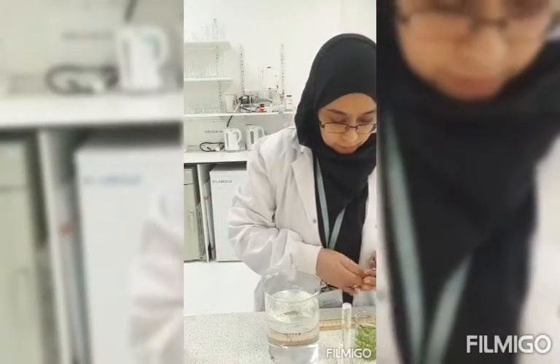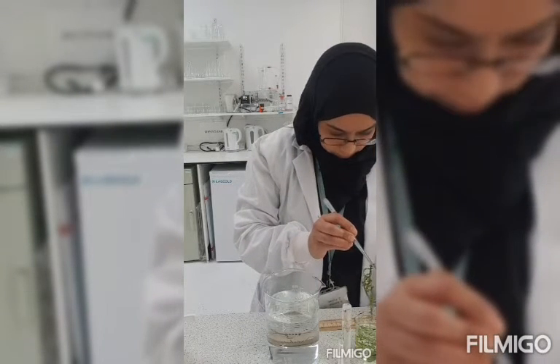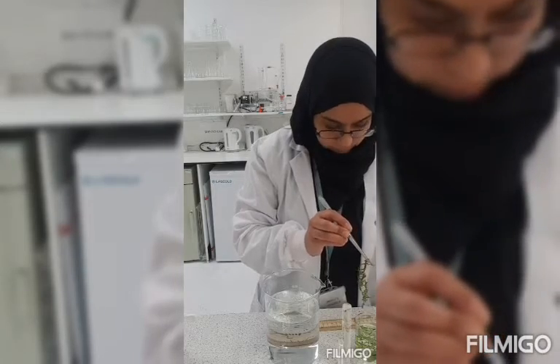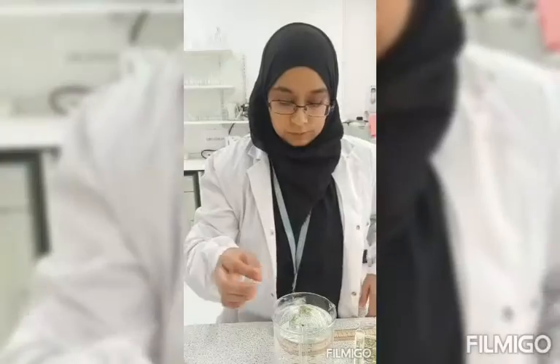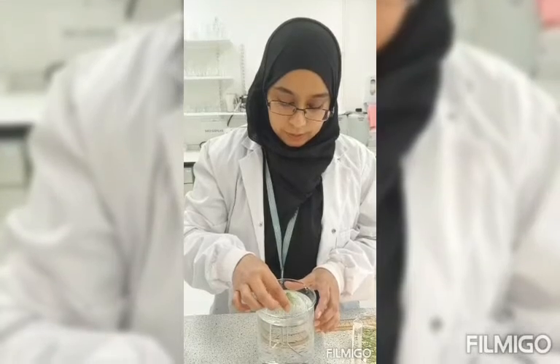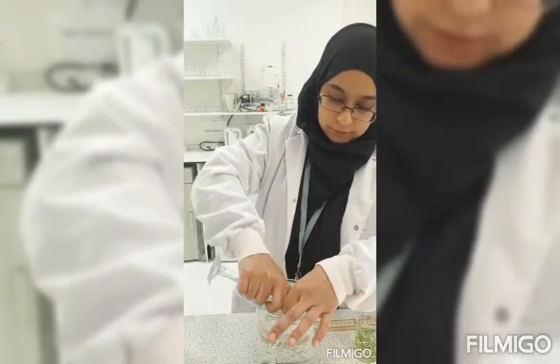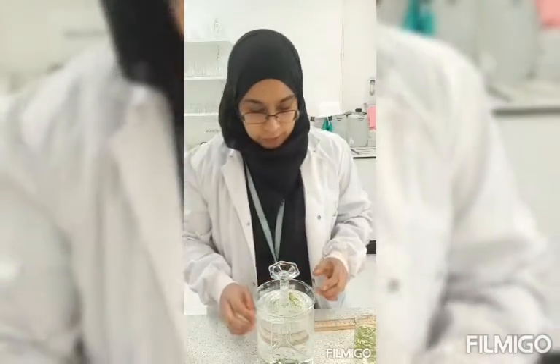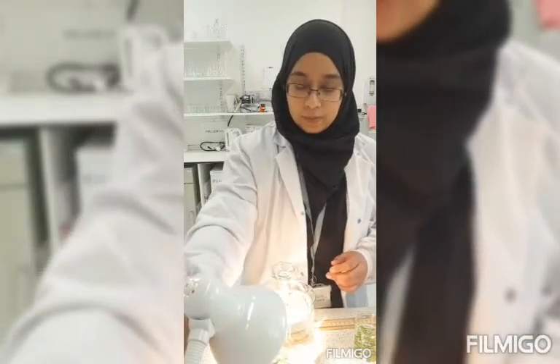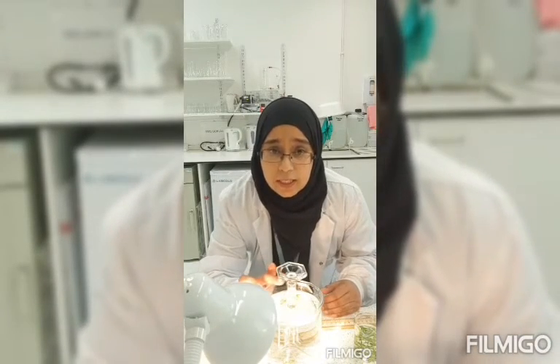What you will do is carefully take out your pondweed, again cut a little bit off, put that in your funnel, carefully lower it down. You're going to gently put down your funnel into your beaker. Using your measuring cylinder, which is full of water, you're going to carefully invert it into your beaker above your funnel, and then with your light source again, allow the plant to photosynthesize, and the amount of oxygen produced will be collected in your measuring cylinder. And this is how you can measure the amount of oxygen being produced.